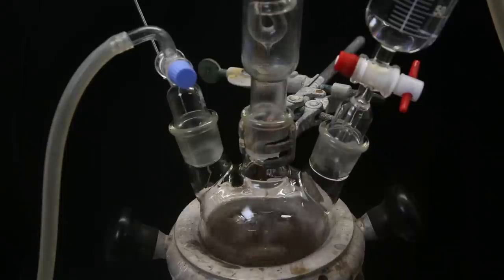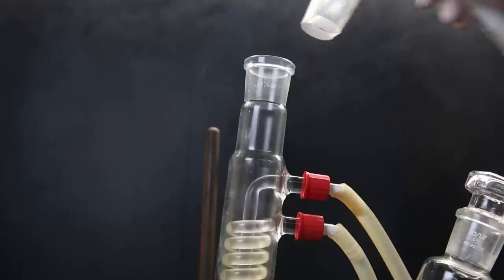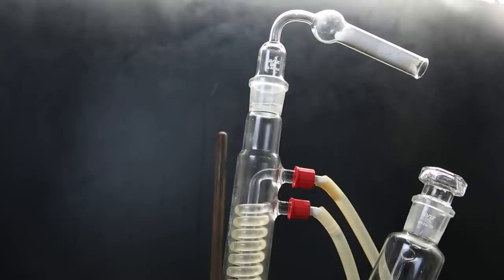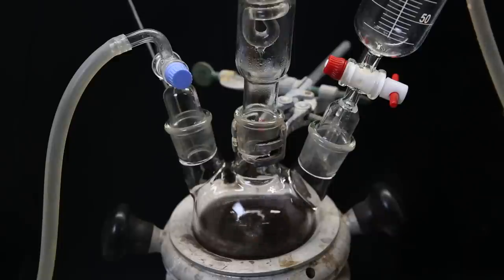While the reaction is running, I stop the nitrogen flow, and attach a drying tube to the top of the condenser, which will prevent moisture from entering the setup. After a while, the addition was complete, and I left it to stir for another hour.